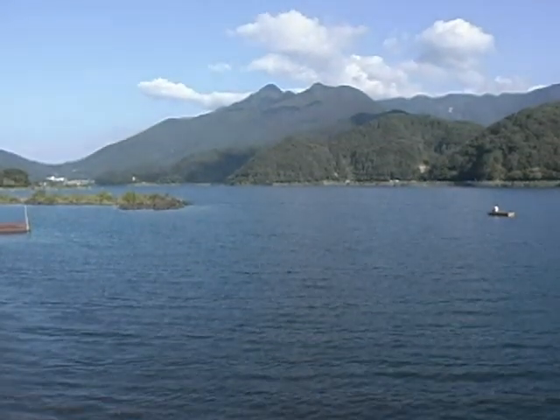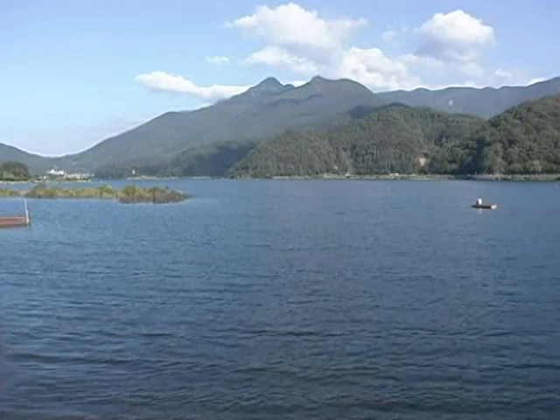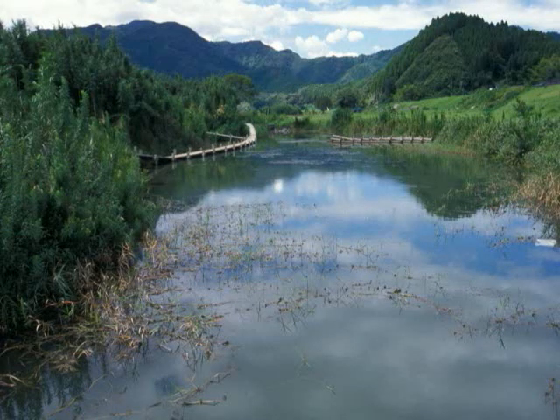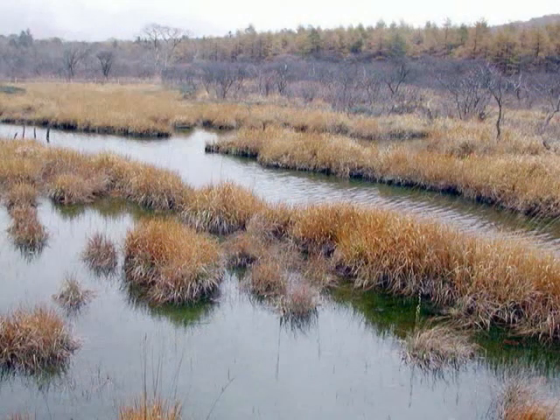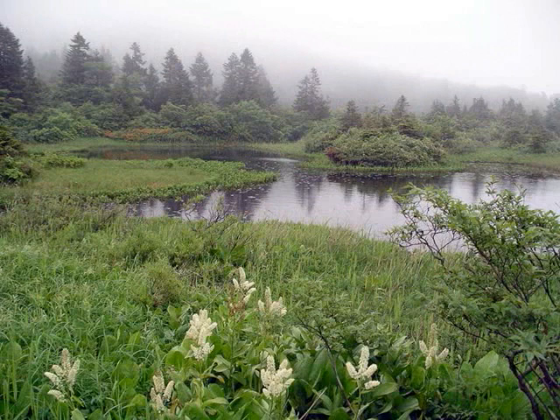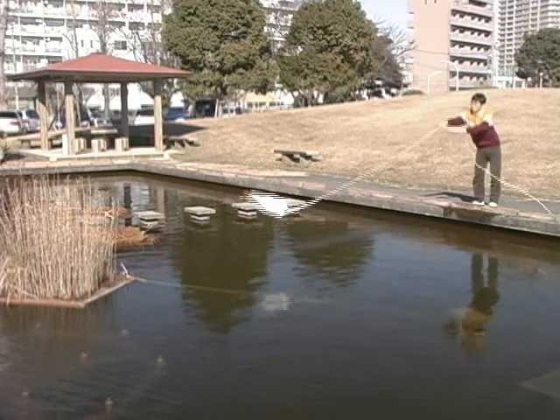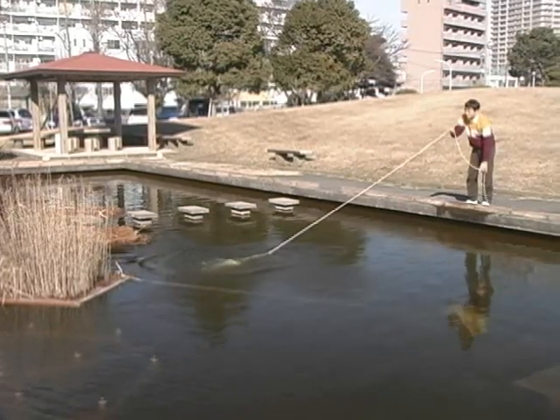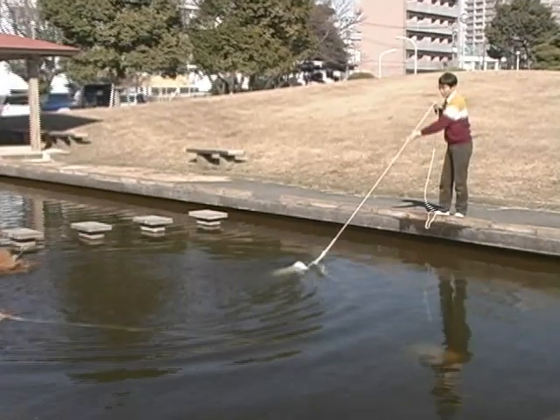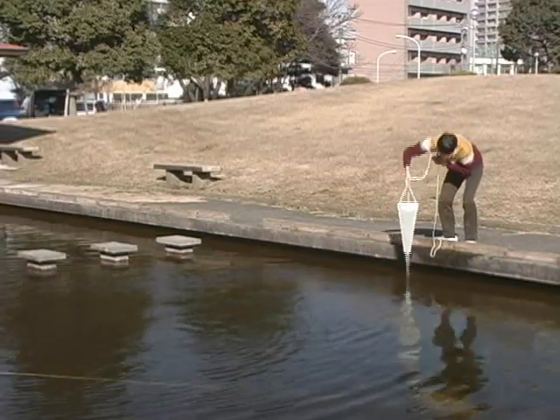Diatoms are the most common micro-aquatic photosynthetic organisms. Diatoms are not only present in rivers, but also live in ponds, lakes, marshes, and moors. In addition to sessile species of diatoms attached to rocks, there are also many free-living species, which can be collected by using a plankton net.